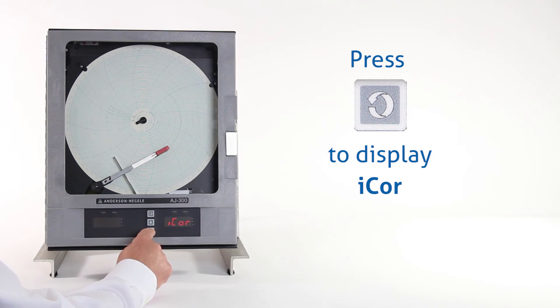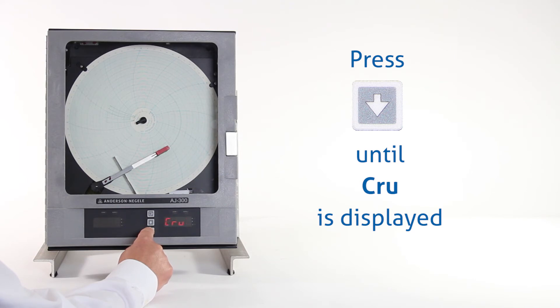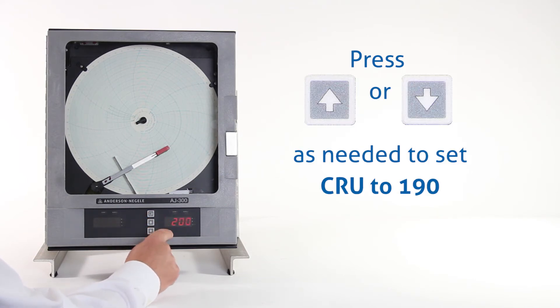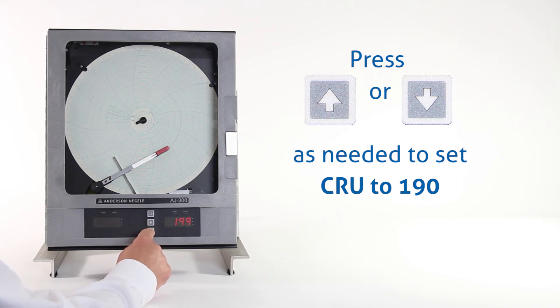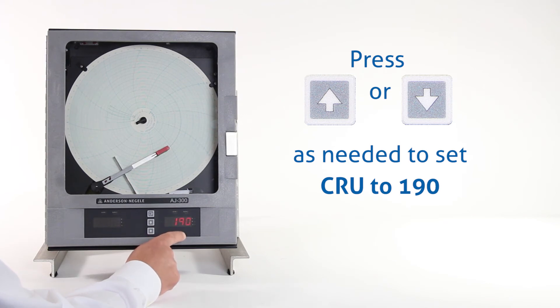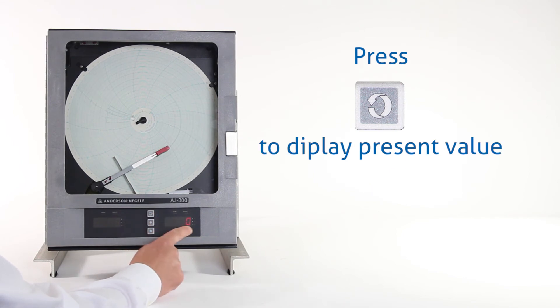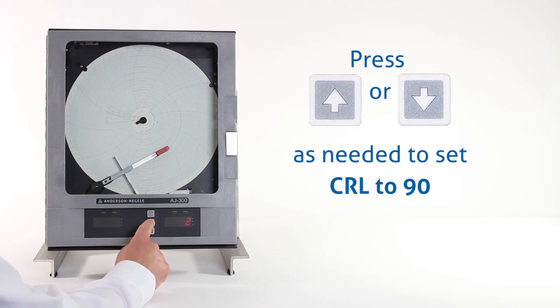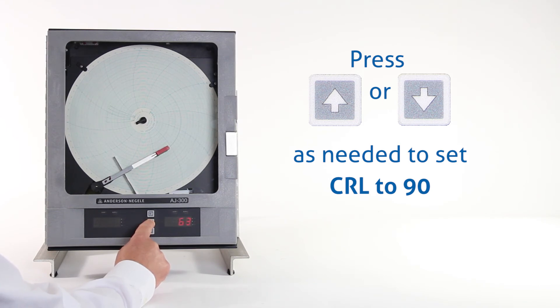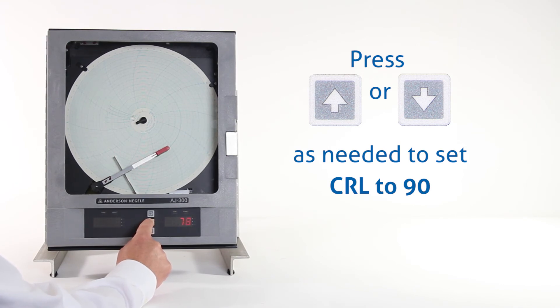Now we're going to use our down arrow key and press that until we get to CRU on the right-hand display — again, that's for chart range upper. We press our scroll key. That's at 200; we want to drop that down to 190 using the down arrow key. Once we're at 190, we press the scroll key to go to chart range lower. Scroll again — we have zero there. We're going to press and hold the up arrow key to run that up to 90. If we get close, we can just let go and then press it repeatedly to get that value up to 90.